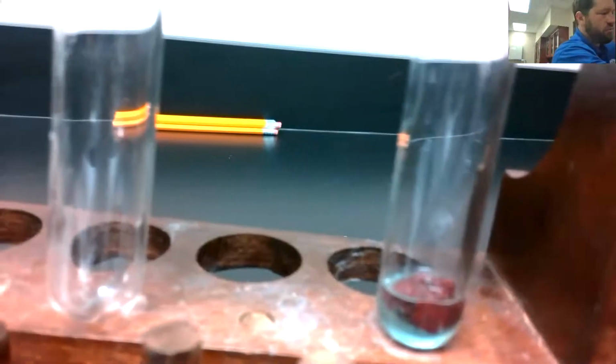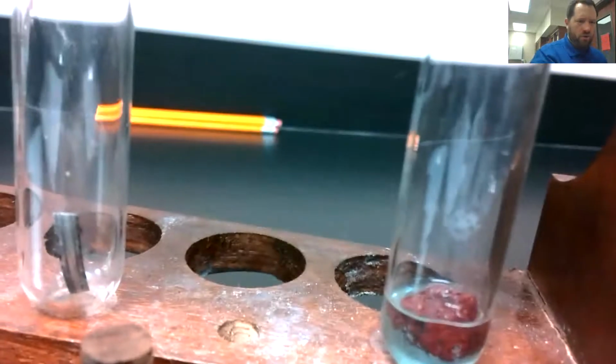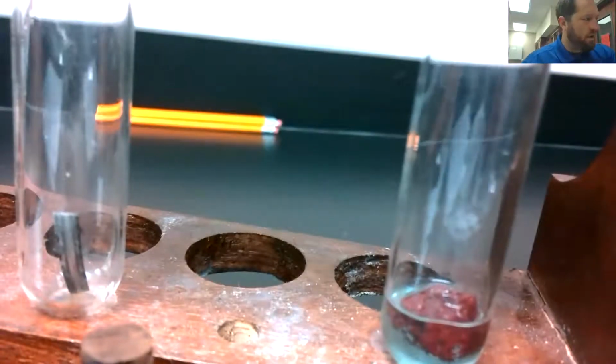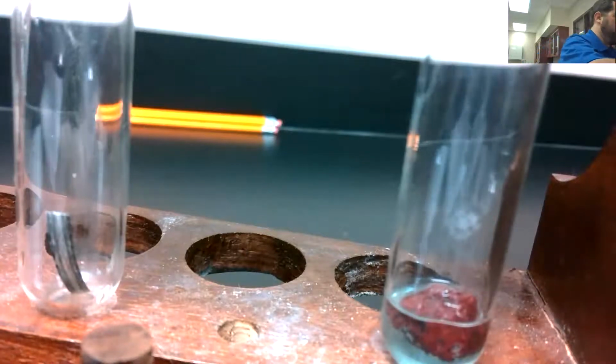We'll focus it and zoom in. I'll have to hold the test tube at the same time. See that? There we go. All right, so there's our solid piece of magnesium ribbon. There it is. There's a good picture of it. That guy right there. There's our magnesium ribbon. Again, I'm going to add some hydrochloric acid.